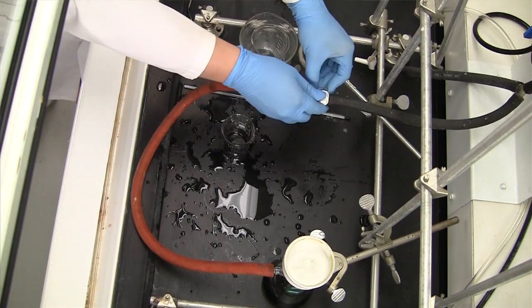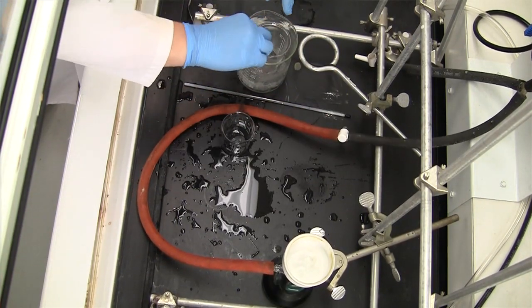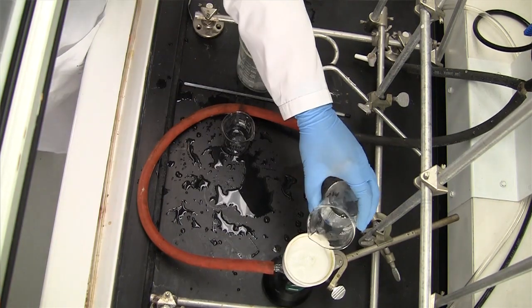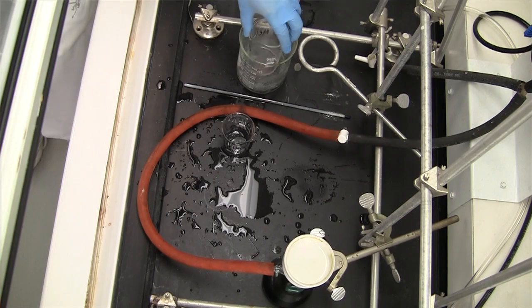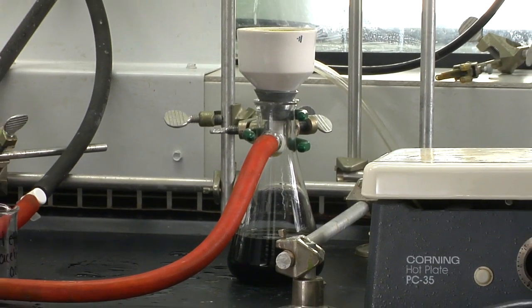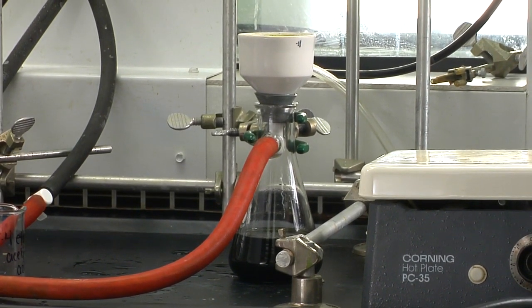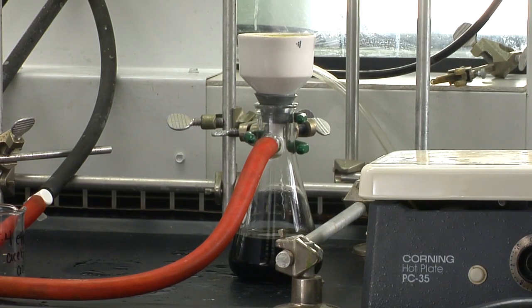Again, we'll stop the suction and add a few mils of methanol. Let it stand for a few minutes, then you can reapply the suction.